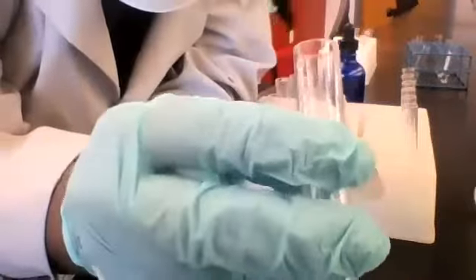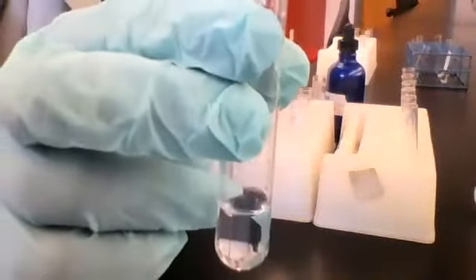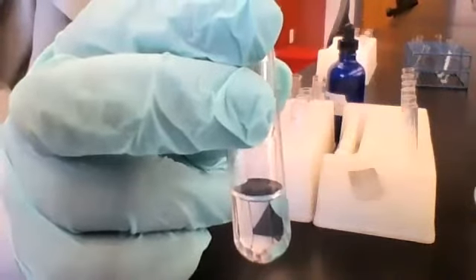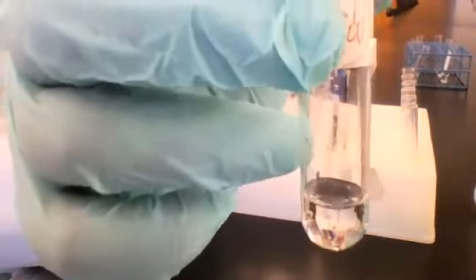All right. Okay, so once again, this is the resulting mixture from combining magnesium sulfate with silver nitrate. All right, moving on. Our next solution is ammonium chloride, NH4Cl. On its own, as you can see, it is a clear and colorless solution. Let's see what happens when we add silver nitrate to it.